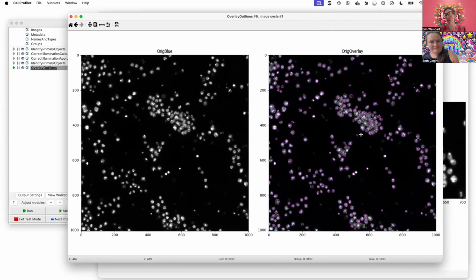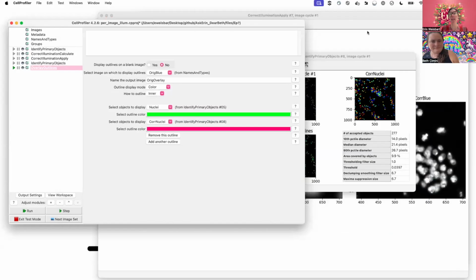So I've made this corrected image, and I'm using it to find these objects. But as a reminder, when I go to make measurements of these objects, I want to do that in my original images. Generally, you don't want to be using this sort of correction for measurements. Whereas with the other type, with the flat field, you do want to apply those corrections before you make any measurements. So it's the same module in CellProfiler, a similar idea, but a very, very different application and usage.